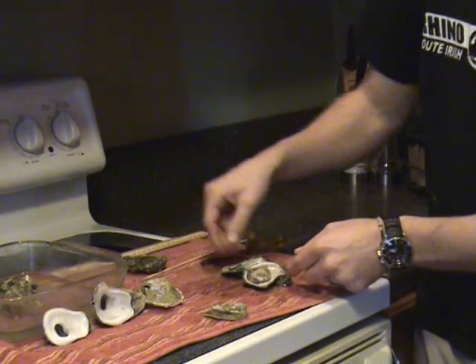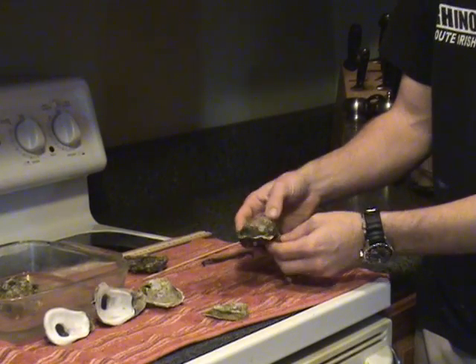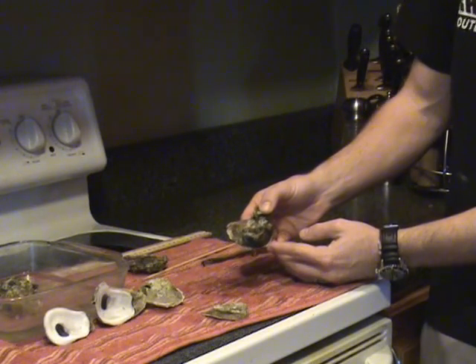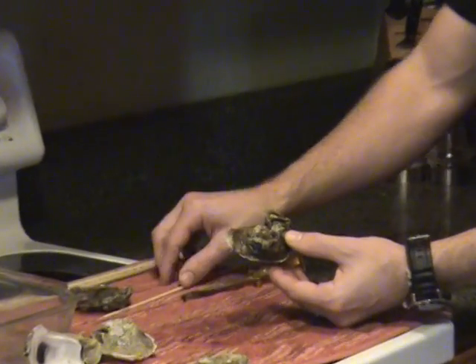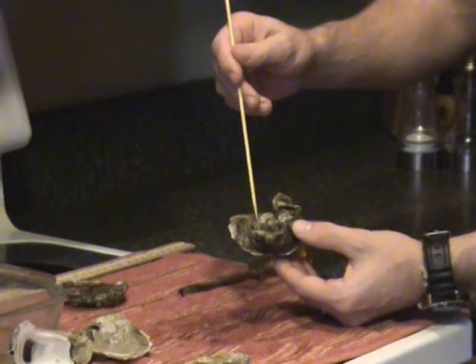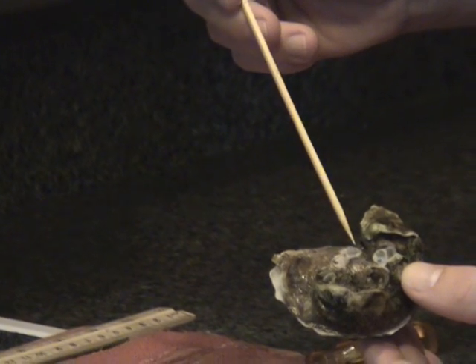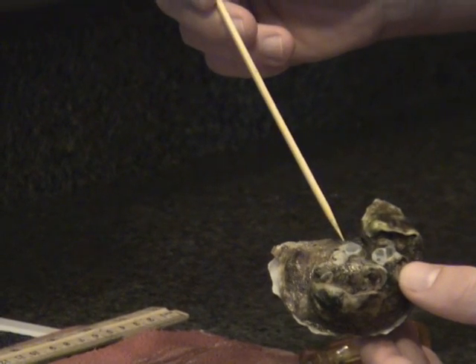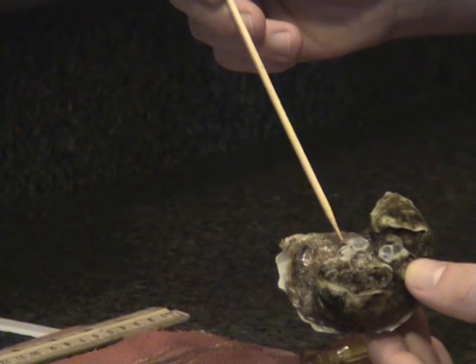Flip the two valves over to expose the external surfaces of the valves. The oyster reef is home to a number of different organisms, and how those organisms utilize the oyster reef can have a lasting impression on an oyster. You may notice barnacles — empty barnacle shells on the valve, or a barnacle scar, which is a footprint scar of a barnacle on an oyster. These scars are typically round and have striations radiating from the center; a footprint scar is evidence of a previous barnacle attached to the oyster shell.